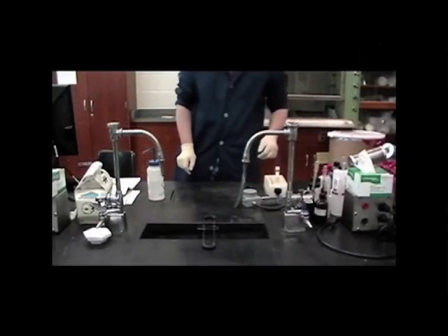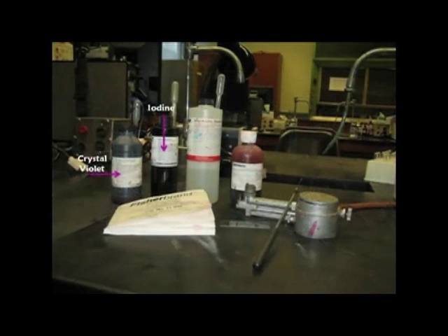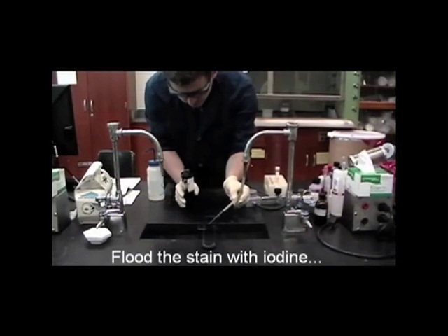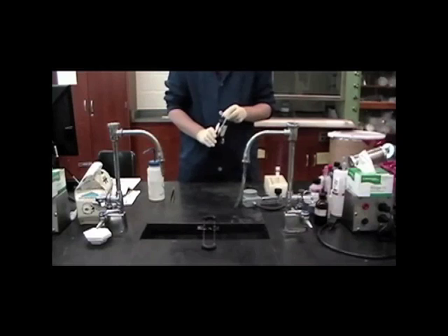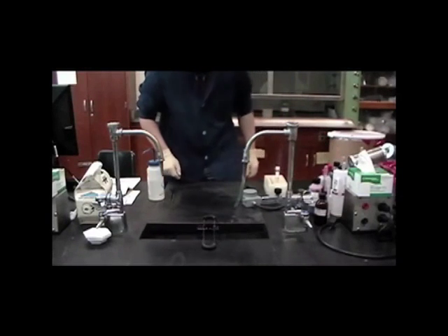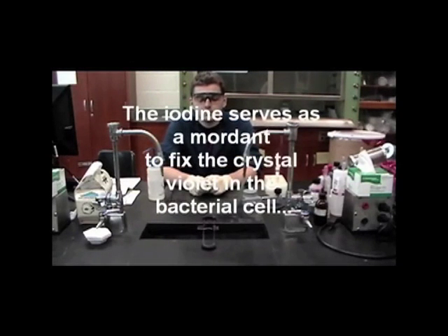The next step is to cover the smear with iodine stain for 1 minute. Flood the stain with iodine. The slide is flooded with iodine, and what we are achieving at this time is forming an iodine crystal violet preparation. And the iodine serves as a mordant to fix the crystal violet in the bacterial cell.